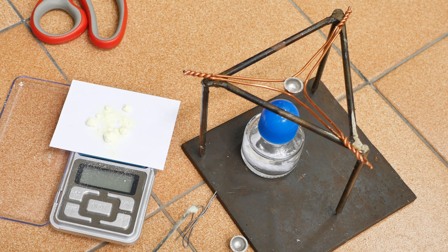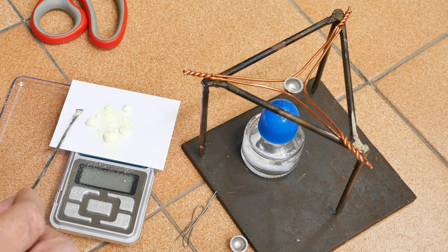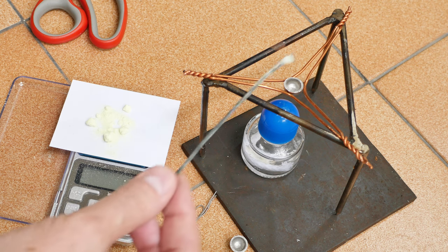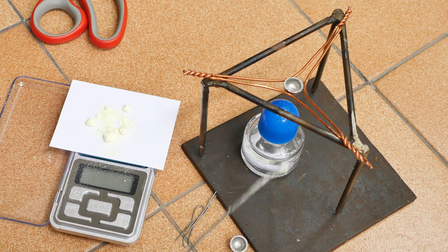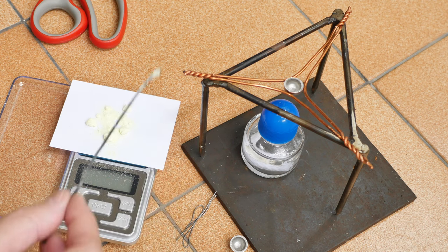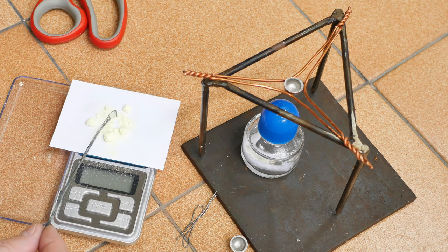I'm going to chop up this lead very finely and put it in here and mix it and set it on fire. Again, you need a respirator, you need goggles, all that protection. The other thing I need to point out is that sulfur burns at half the temperature at which lead melts. So before the lead is even up to melting, this stuff's going to catch fire. And again, bad fumes and all that stuff.